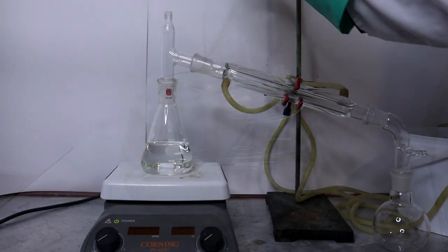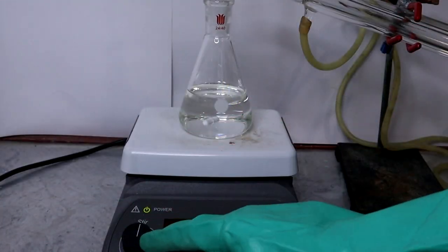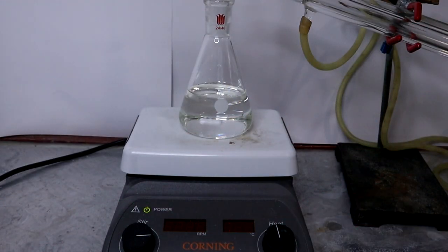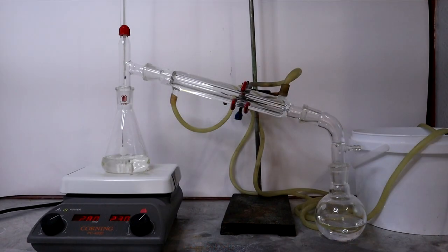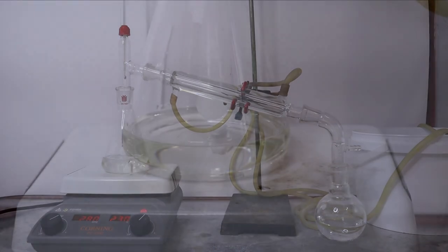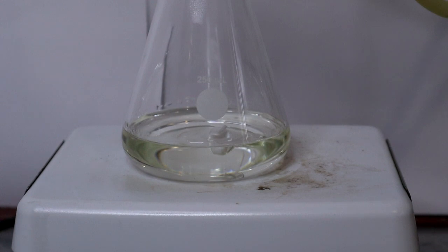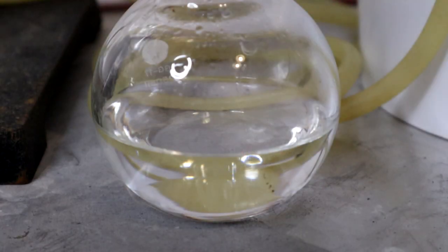At the end of 39 hours, I then switched to a distillation setup to concentrate the solution. Hydroxylamine hydrochloride is extremely soluble in water, and no crystals were apparent in the mixture just yet. In the collection flask, I collected about 125 milliliters of distillate.